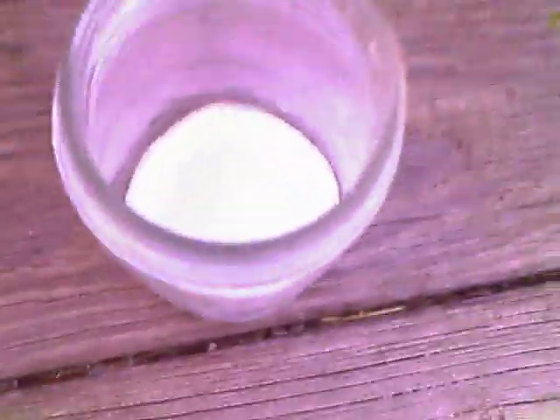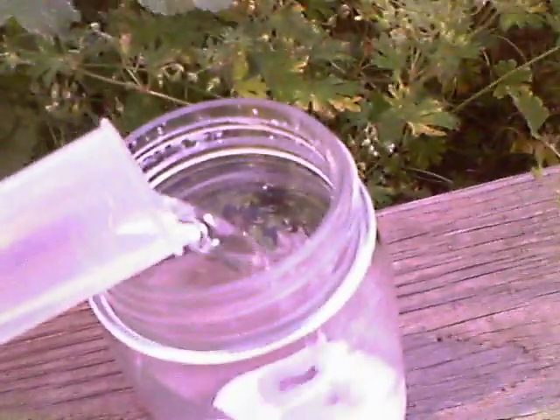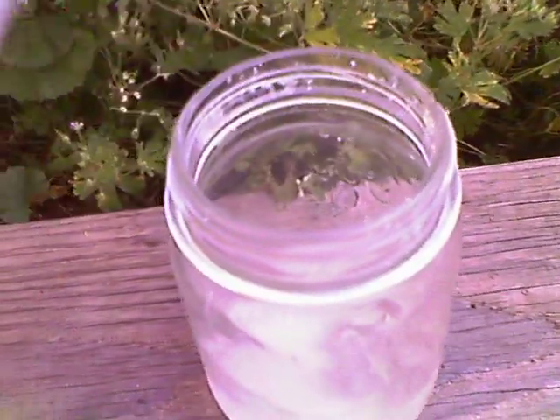I haven't really done it molar to molar. And then right here, add some salt. I'm going to pour it in. Ions are going to exchange. Then dissolve it completely, so it'll take a little bit.